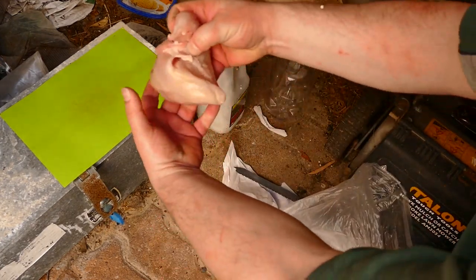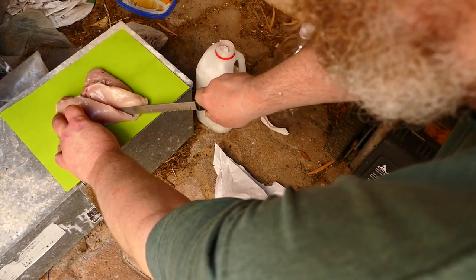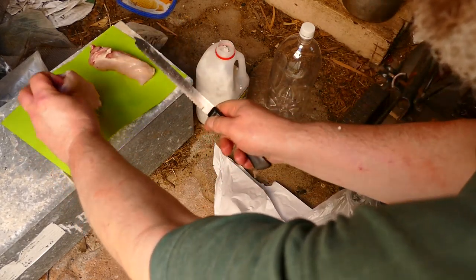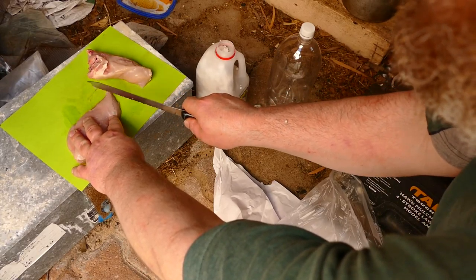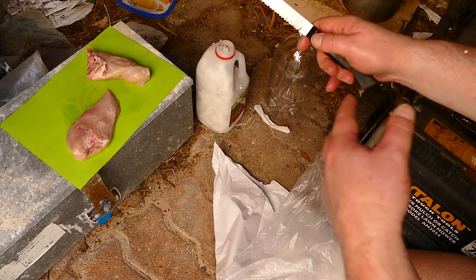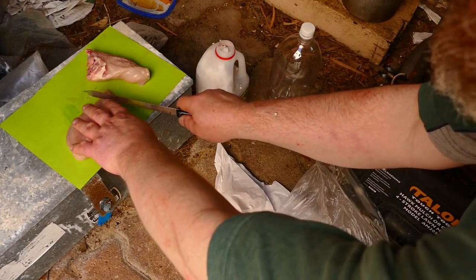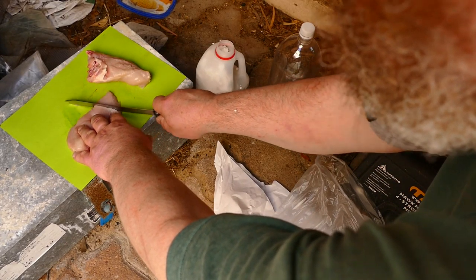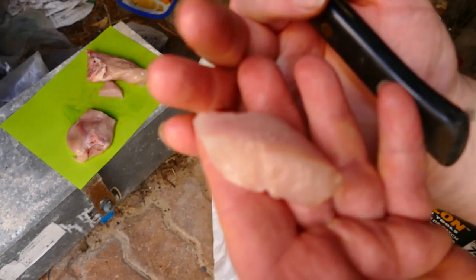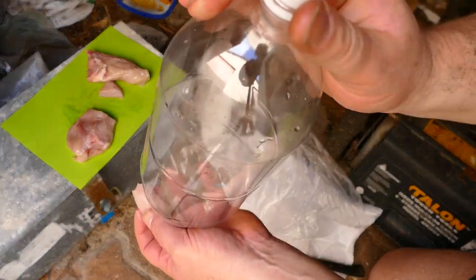We have to cut it up into bigger chunks first. This is just a qualitative experiment, not quantitative — we're just checking does it work or not. Is this nitrogen pathway carnivory what the organism wants? I'm going to cut something the size of a snail or a slug, something that's accidentally fallen into the bottle.